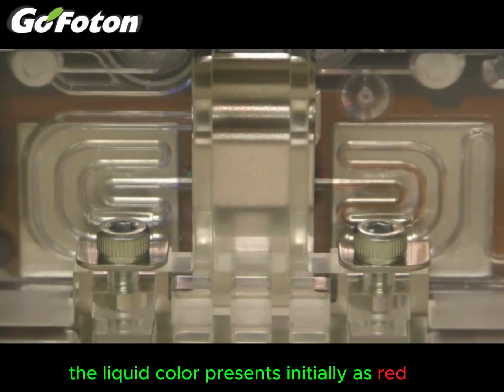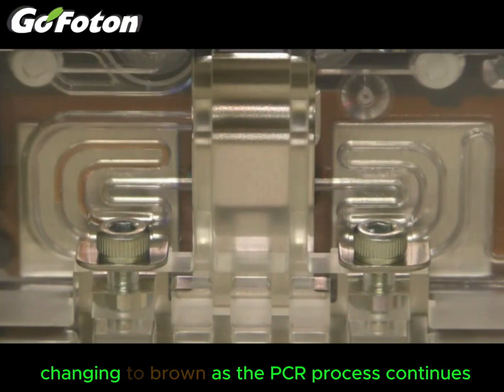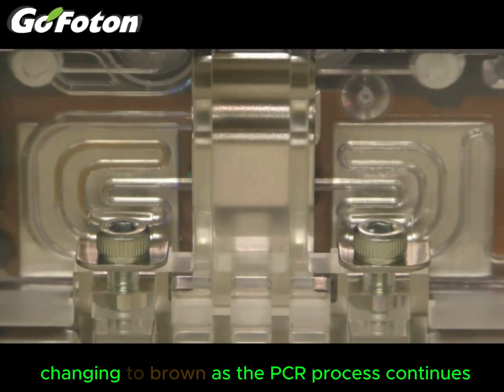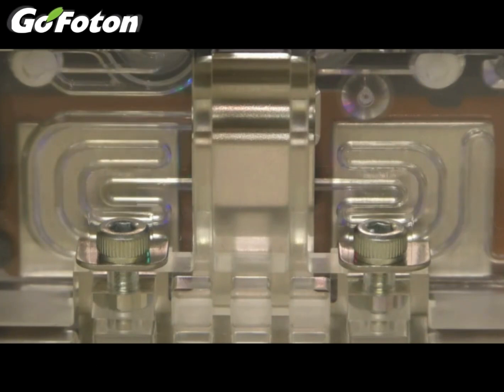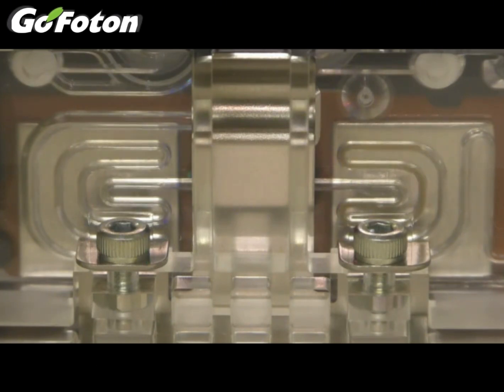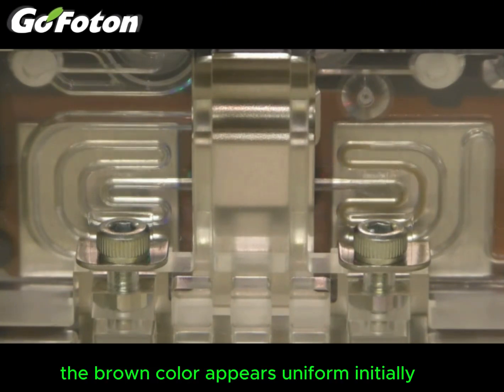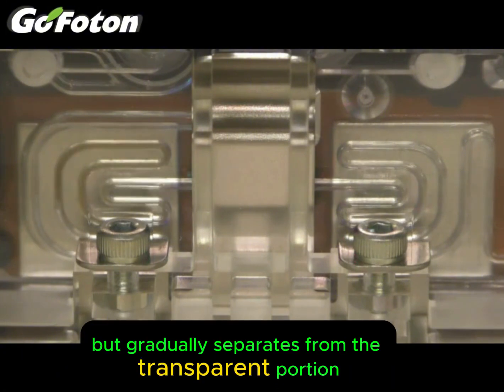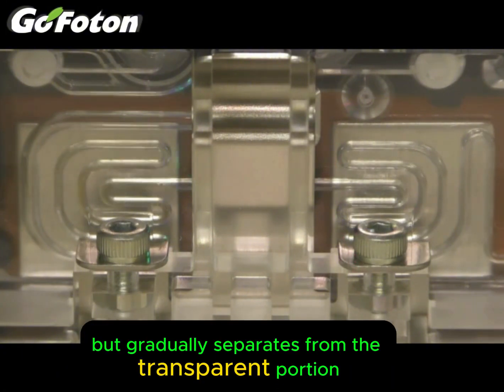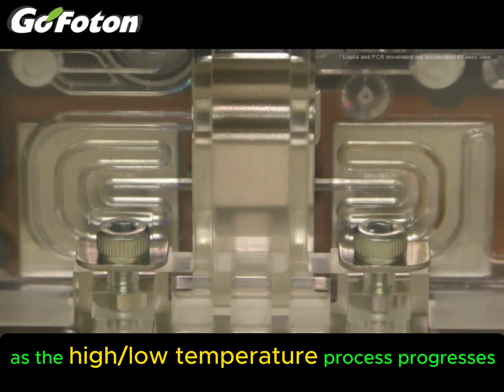The liquid color presents initially as red, changing to brown as the PCR process continues. The brown color appears uniform initially, but gradually separates from the transparent portion as the high-low temperature process progresses.